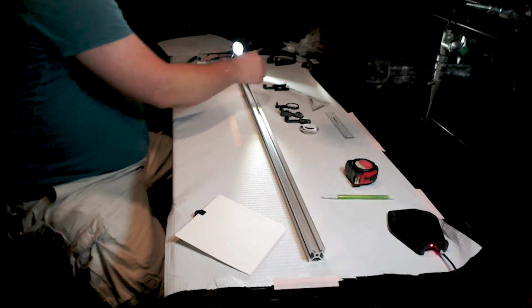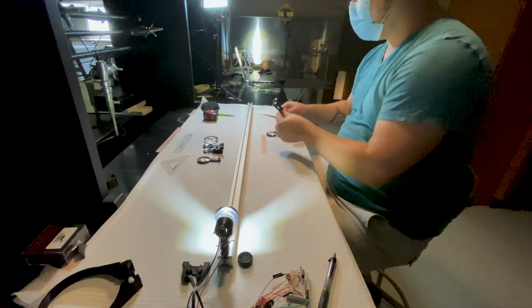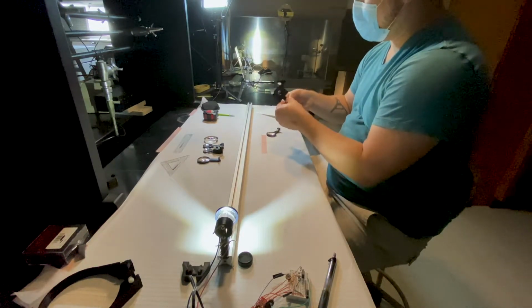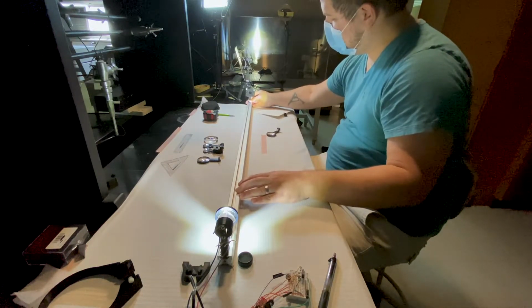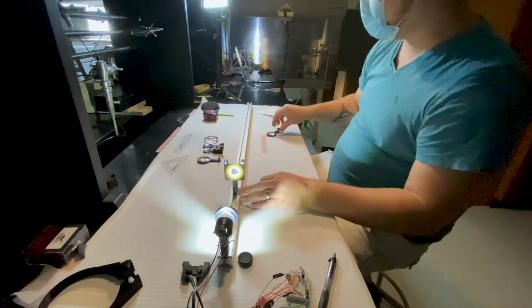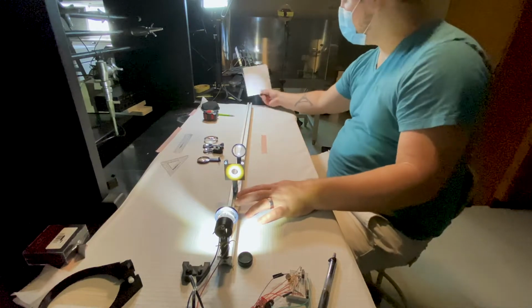And then, the other thing I needed, before I put that on, I needed to put my sample holder. So slide that guy off, slide this guy on. And this is just effectively something that you can mount flat samples to that allows it to be in the optical path of our microscope. So we have our sample holder, we have our lens, and then we have our image plane.